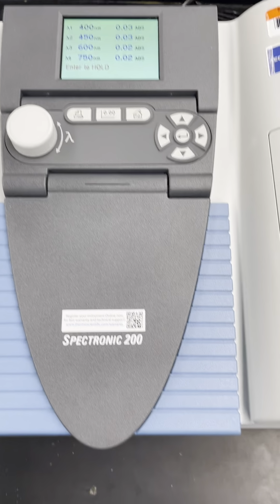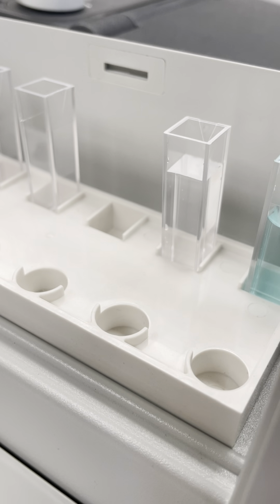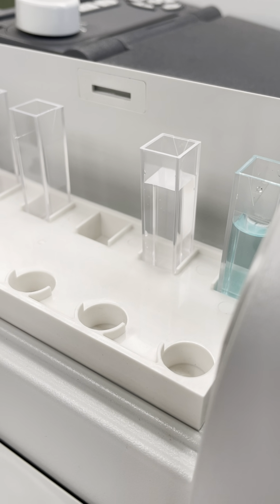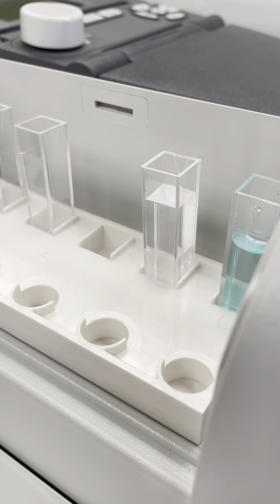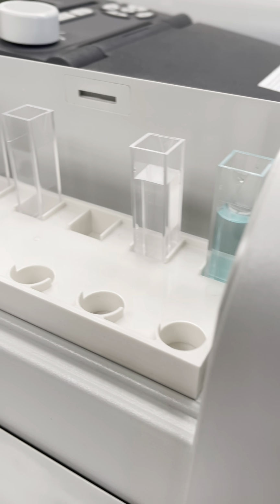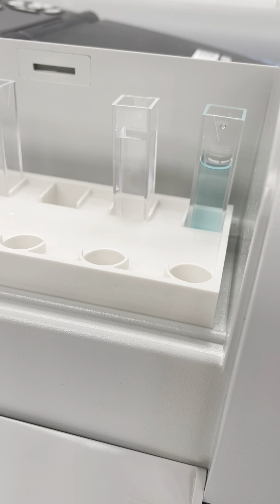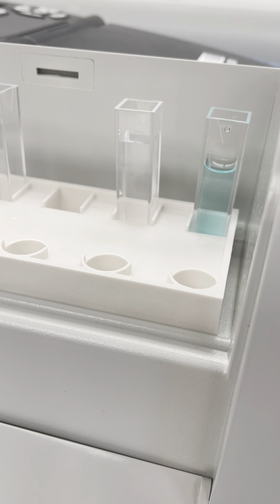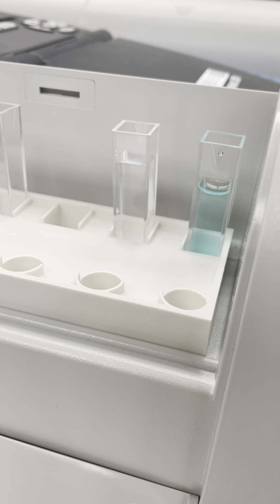What I have here is a blank inside a cuvette. You see that one side of the cuvette has a triangle and the other sides do not. Those other sides are where you're going to handle it, and then you're going to put the triangle in the light path. Because this is an aqueous environment, I'm going to blank with water, and then at these 4 wavelengths, we'll take some absorbance measurements of this blue compound.